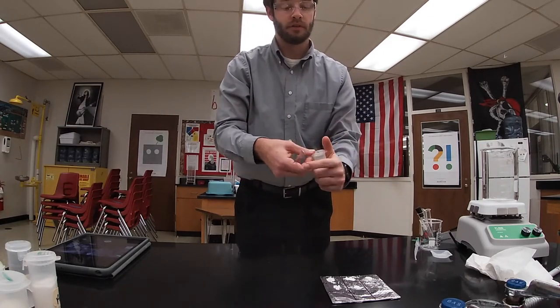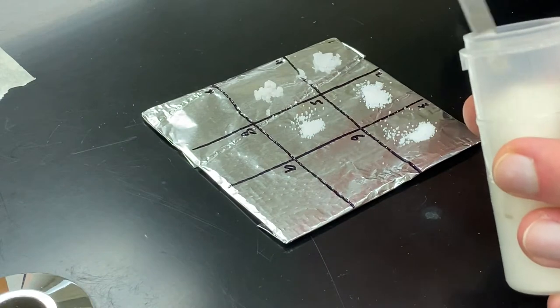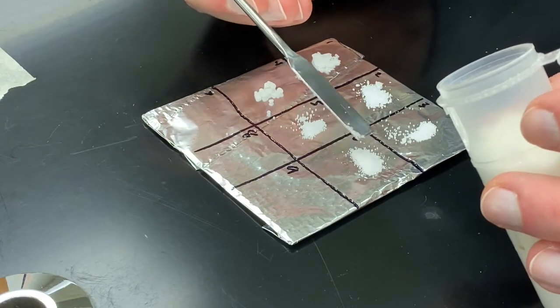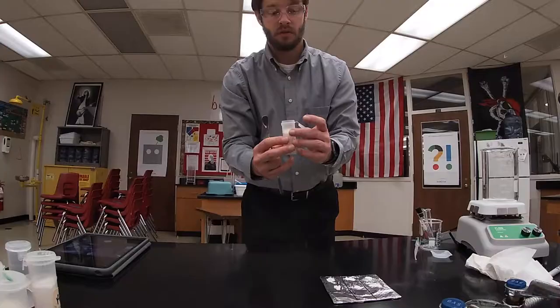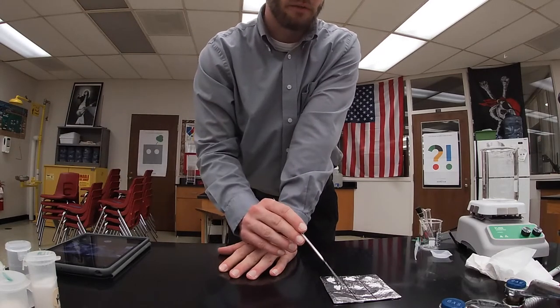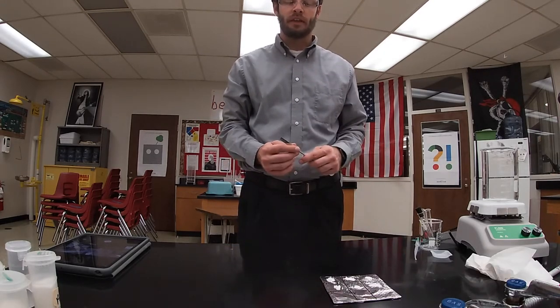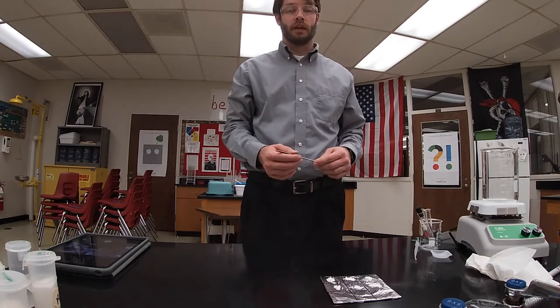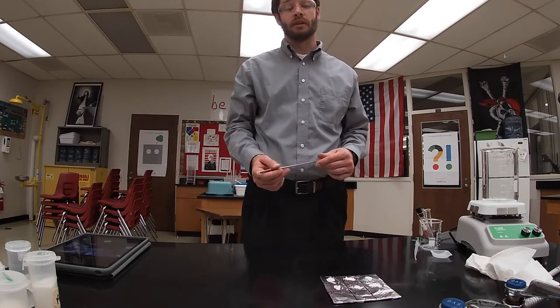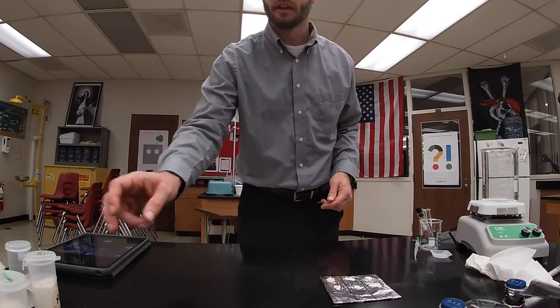Next I have sucrose — just common table sugar. It is a disaccharide of glucose. Next up I'm going to have nitrogen. Nitrogen is more of a hypothetical substance in this case, because nitrogen has a melting point of negative 210°C. The air we breathe is composed of 78% nitrogen, so I could say nitrogen is on that square as a sample, but of course it is in the gas phase.